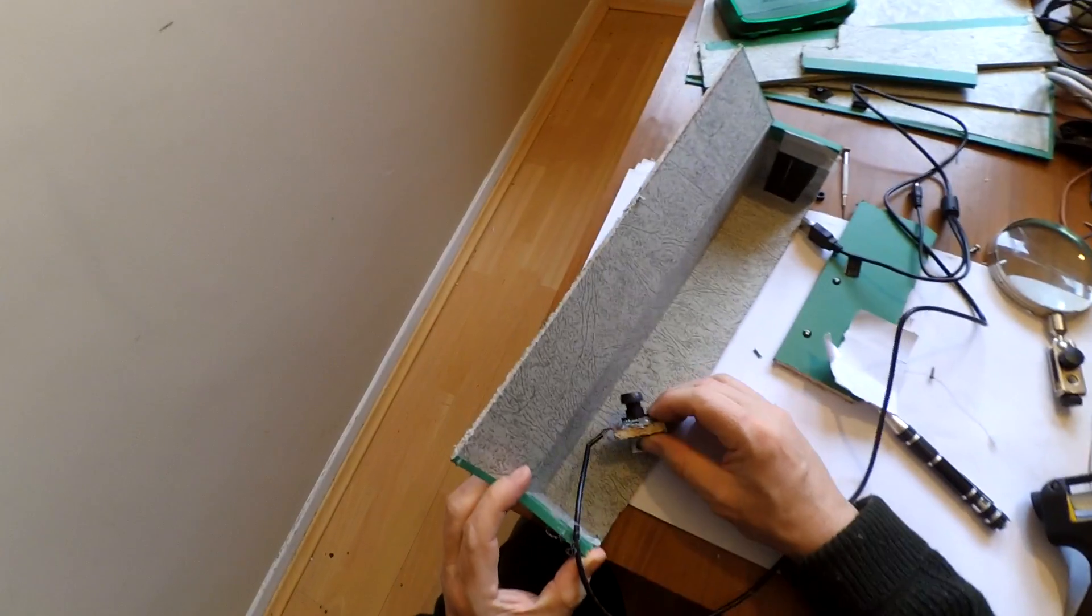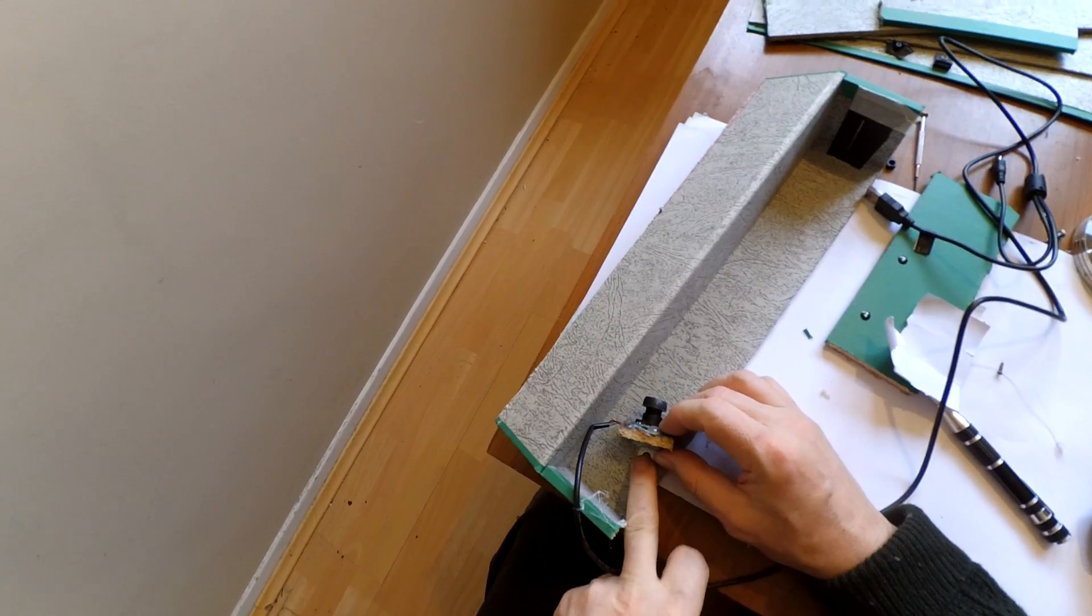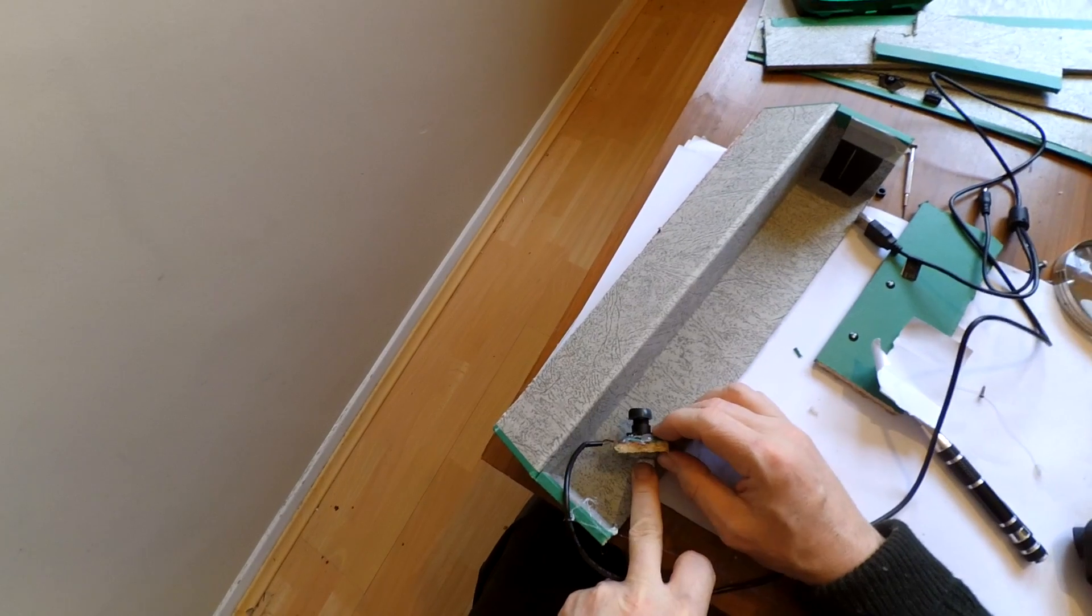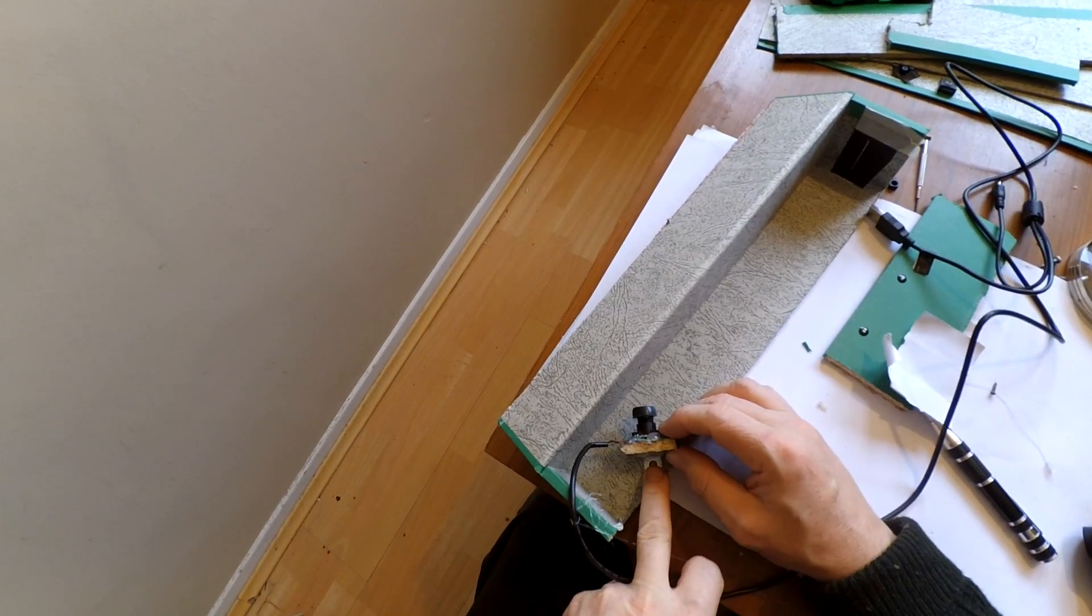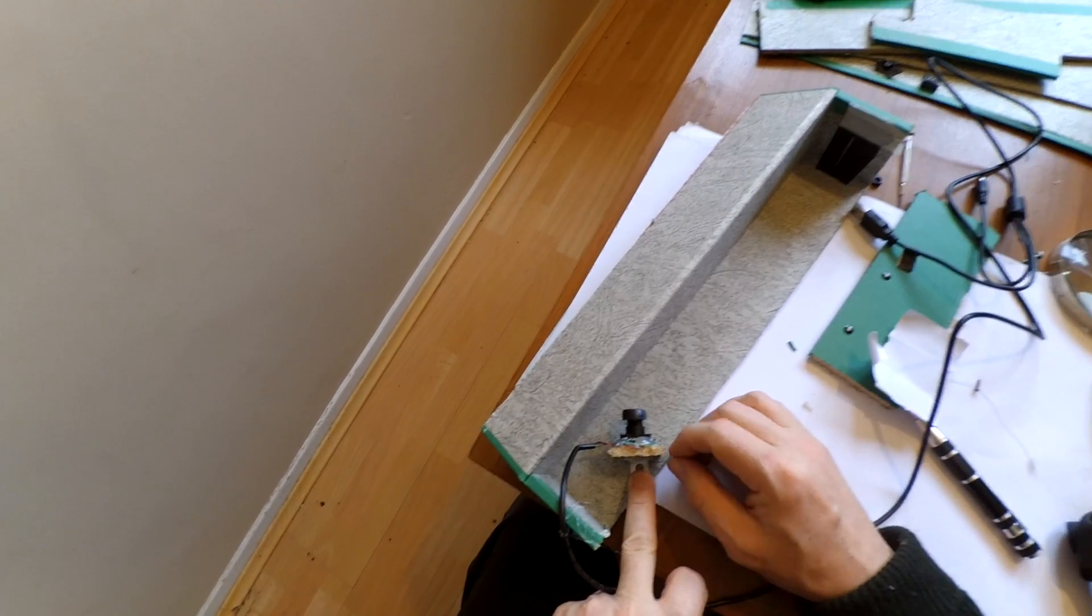Then it was time to think about positioning the camera assembly inside the enclosure. In fact, I turned that bracket around so that the pivot point was underneath the camera's lens.